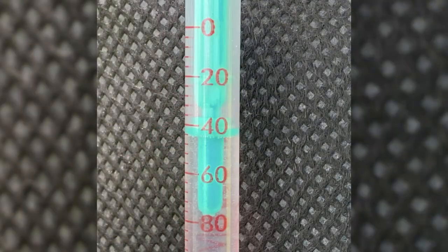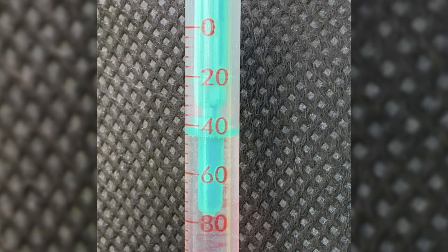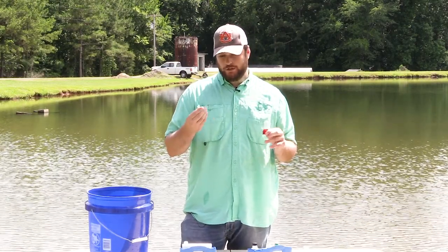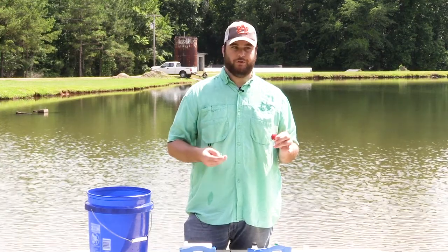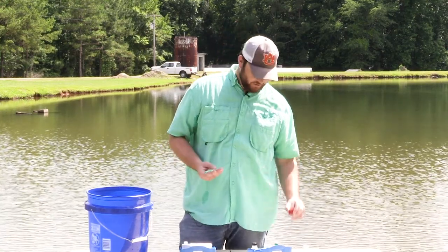This was at 40, and since we doubled the solution, you need to divide by two. And so that would mean 20 parts per million, which is adequate for your pond.